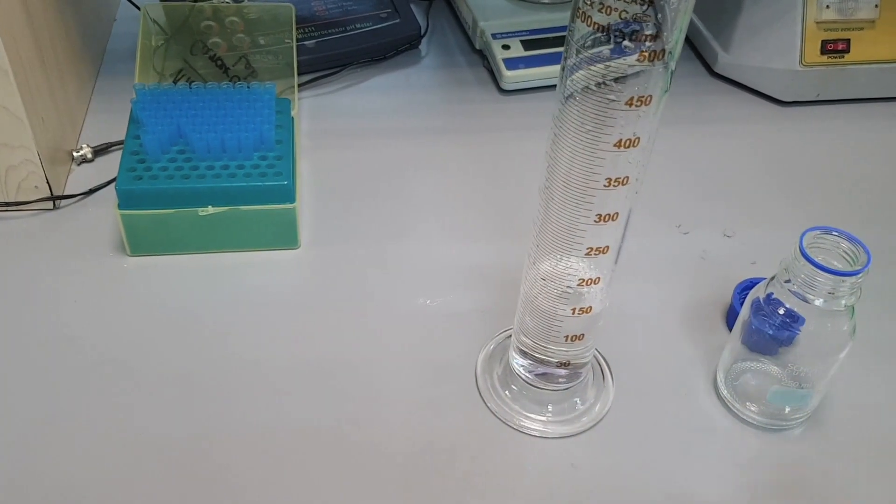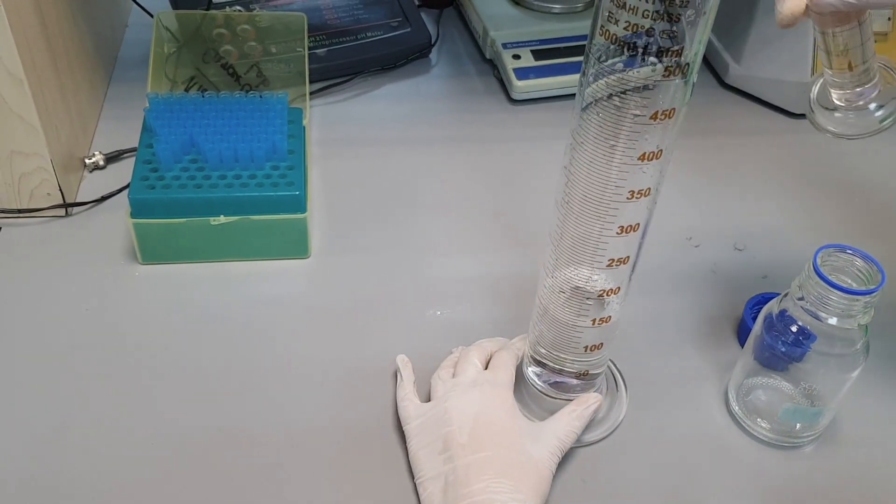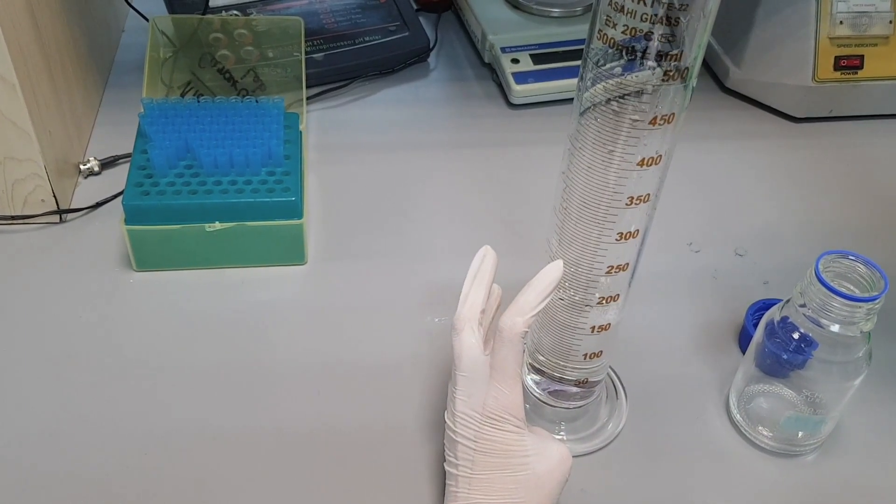Finally, make up the final volume of the solution to 250 ml by adding distilled water and autoclave it to get rid of any contamination.